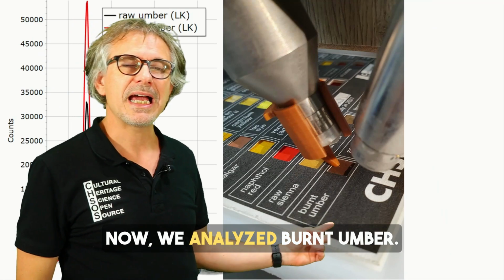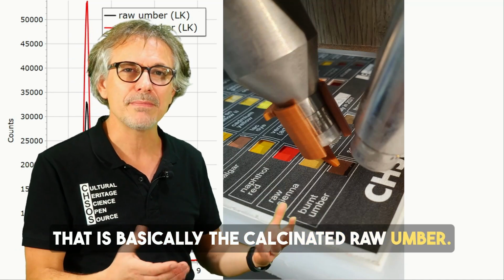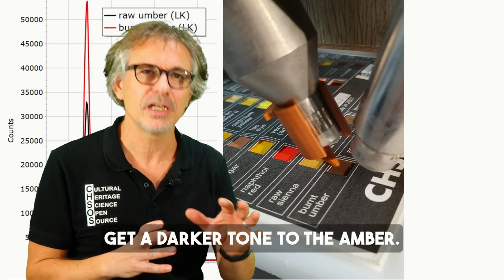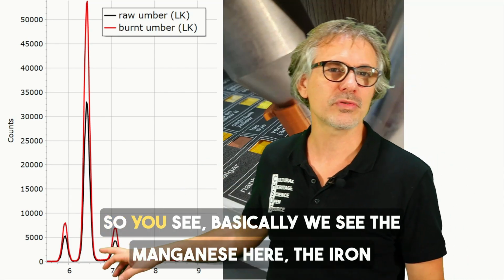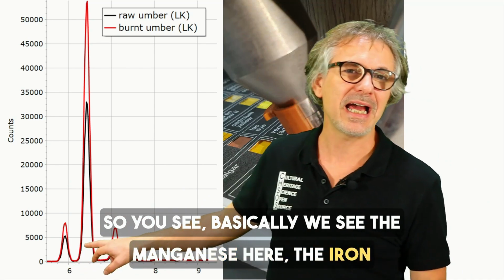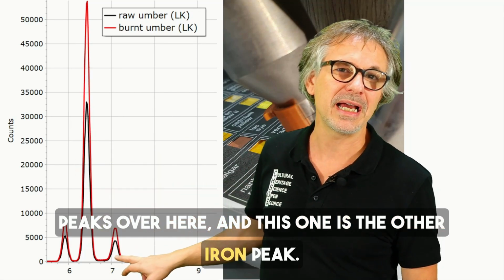Now we analyze burnt umber, that is basically the calcinated raw umber, and this calcination is done in order to get a darker tone to the umber. Nothing changed basically in terms of the XRF spectrum, so you see the manganese here, the iron peak over here, and this one is the other iron peak.